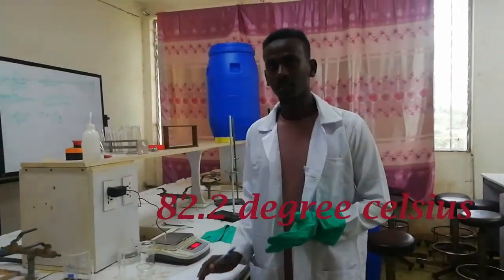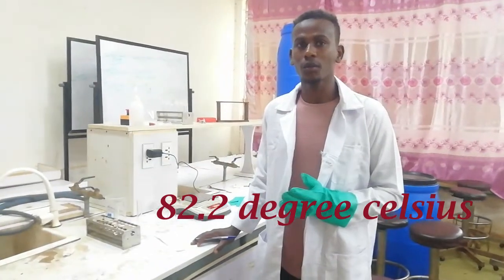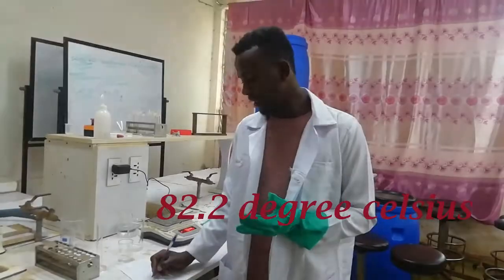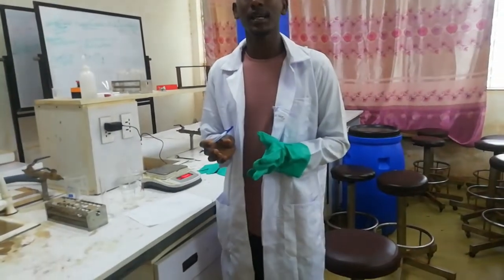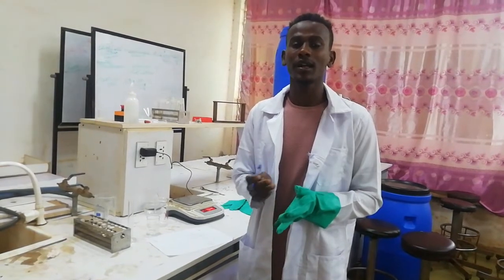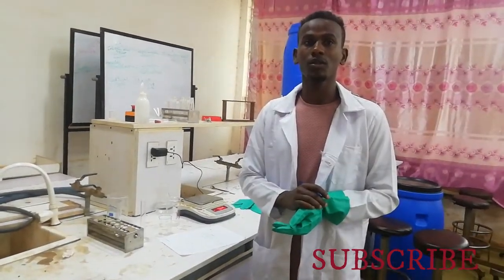As we know theoretically, the boiling point of cyclohexene is 82.8 degrees Celsius, and we obtained practically 82.2 degrees Celsius. So we can conclude that our unknown substance is cyclohexene. This is all about identification of a substance by using physical properties.